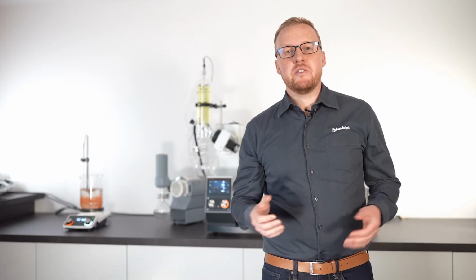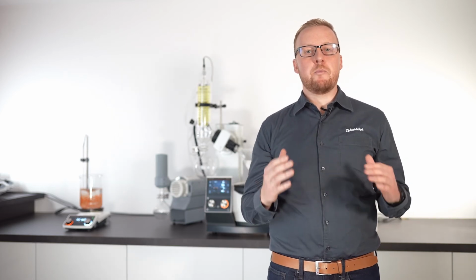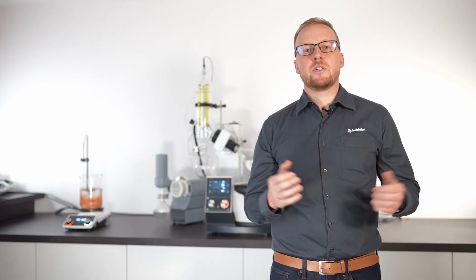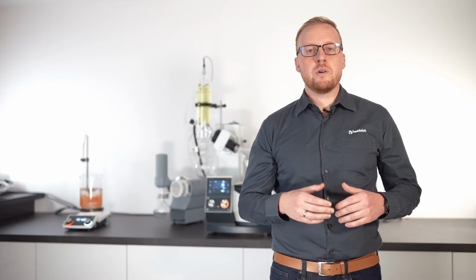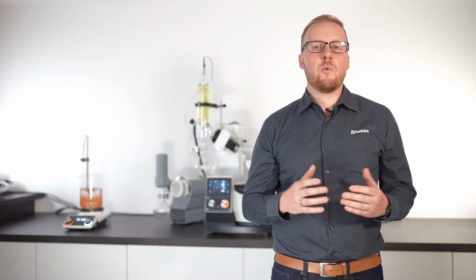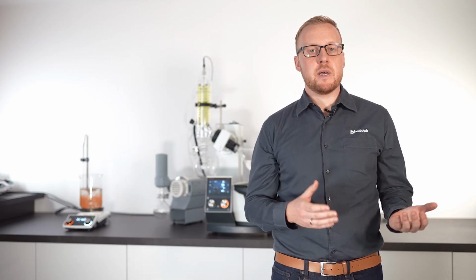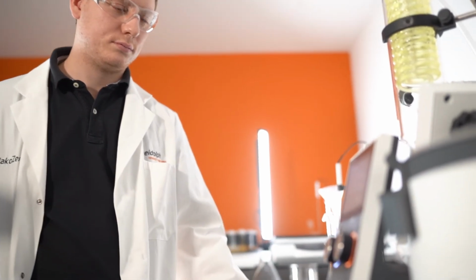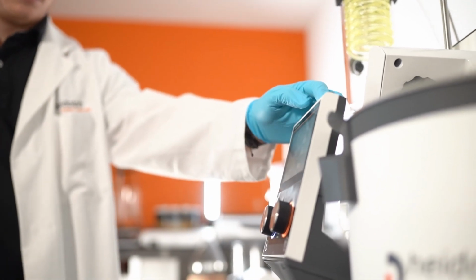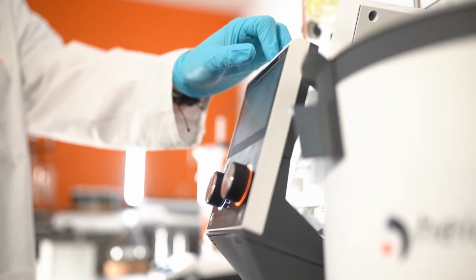So, summarizing, you saw that the dynamic AUTOaccurate function allows you to run an evaporation process on a perfectly balanced and most efficient level without the need of monitoring. You can invest this time into other research tasks. Moreover, due to the very sensitive step-by-step evacuation process, it can avoid foaming and bumping, and it addresses and finds the boiling point automatically. If you are interested, our application specialists are happy to assist you and to check which improvement potential the DAA mode offers for your specific application.